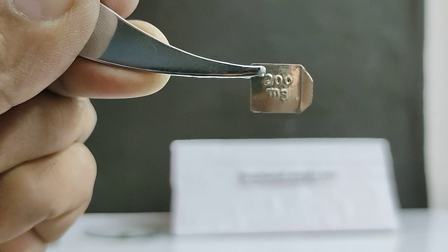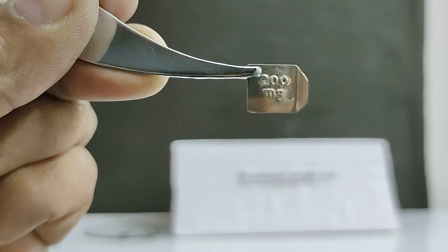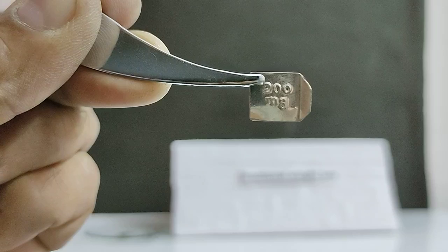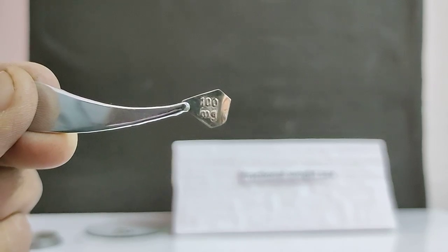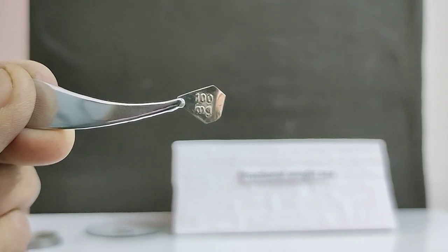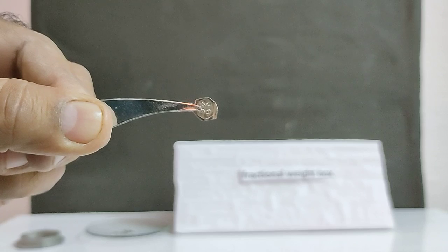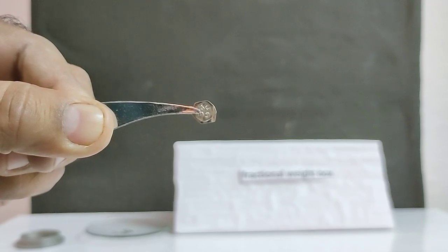Two weights of 200 mg square in shape, triangular shape of 100 mg.